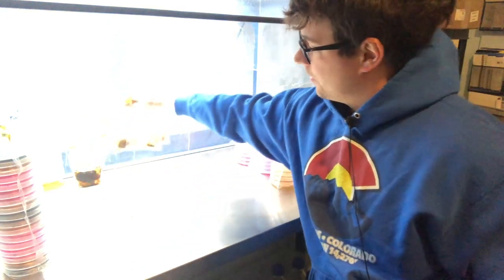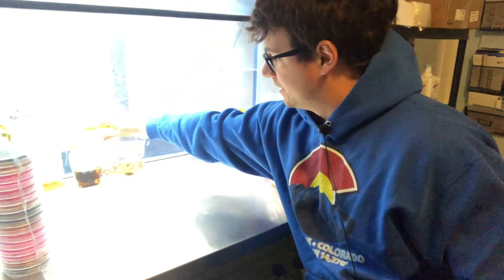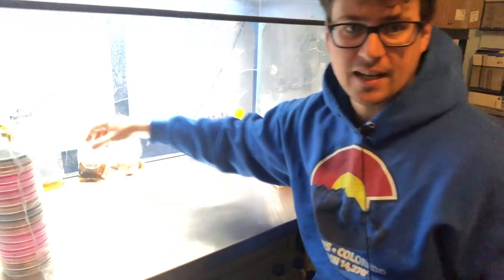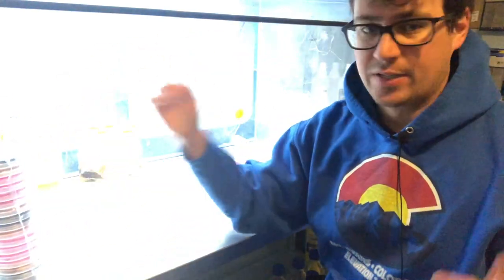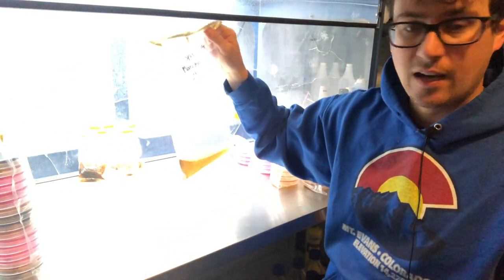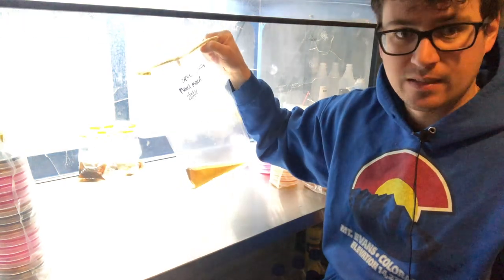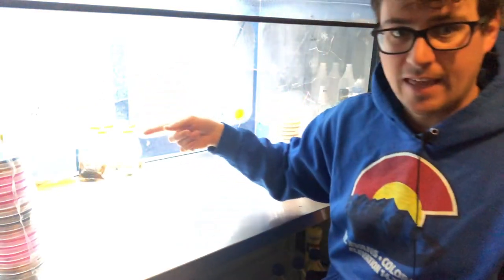So we took a bunch of different samples of some Morchella species that I collected over the years and I created a spore solution and inoculated it onto these plates. Someone had mentioned about mixing all of the different types together and inoculating that onto a plate, so I created this spore slurry mix with all the different species and I wanted to plate that out as well.